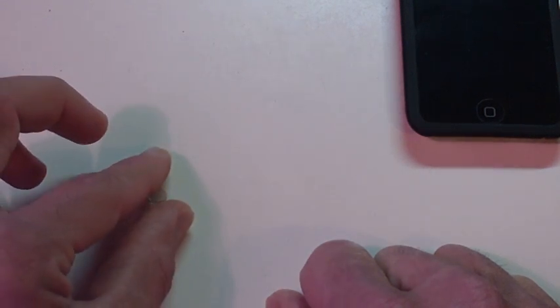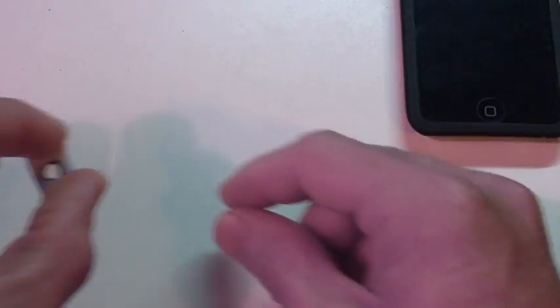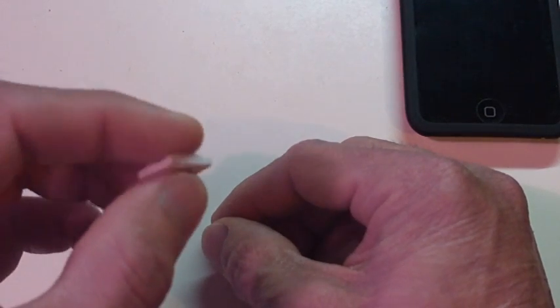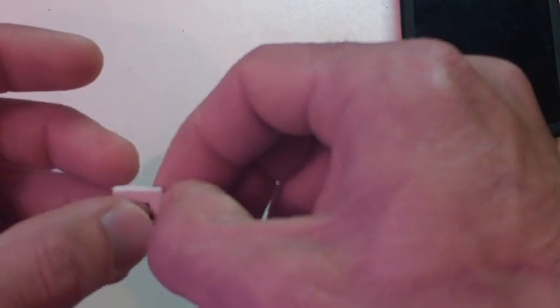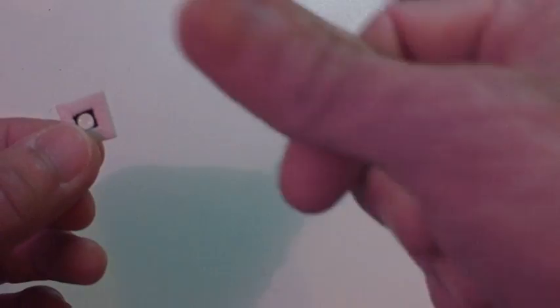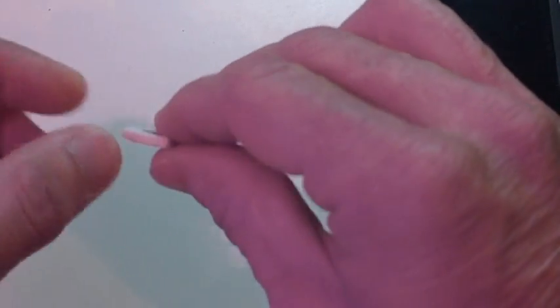Okay, what you want to do with that? You want to make kind of a frame this way. This is just a sample that I made yesterday. It's made out of plastic, I would probably say a spongy rubber. There it is. You just cut it off, make the shape out of it. And then you just stick the lens inside so it stays flat and stable. See that?